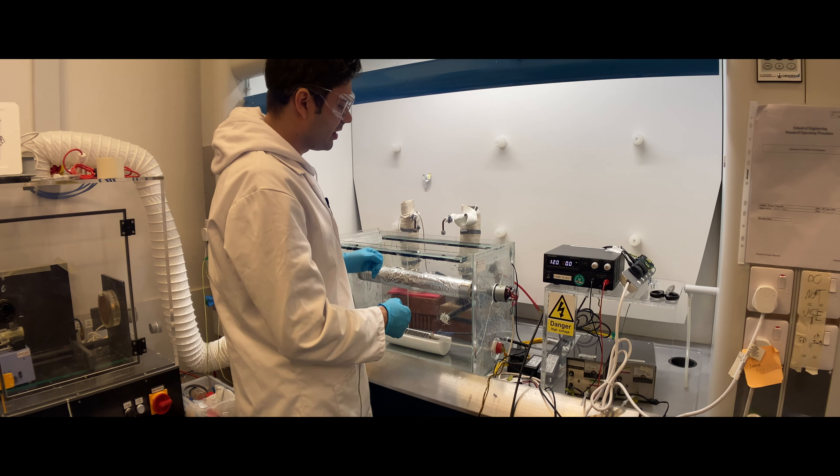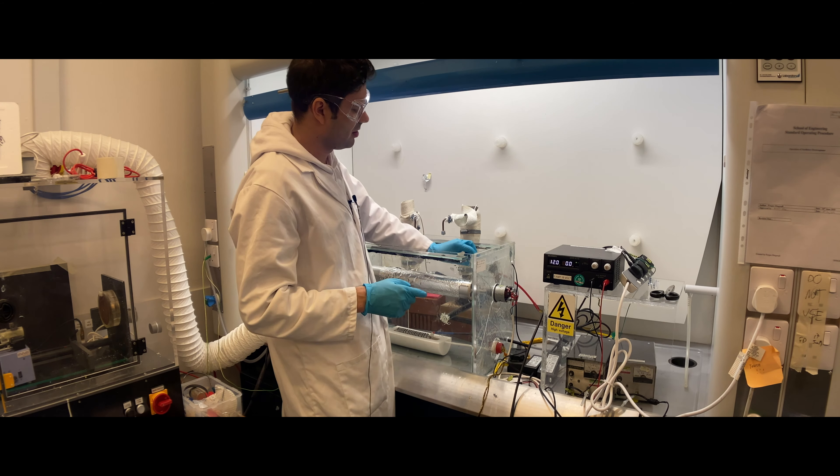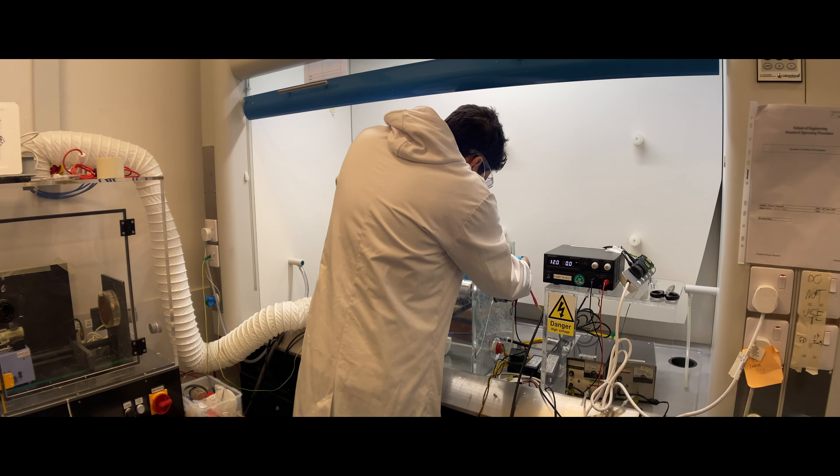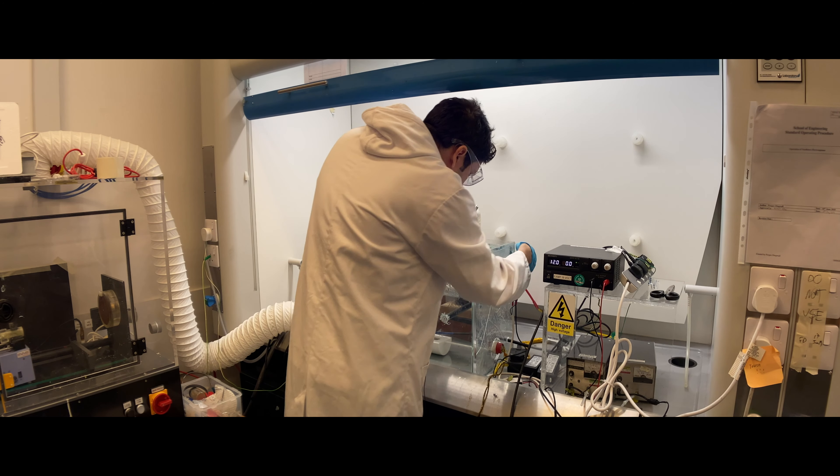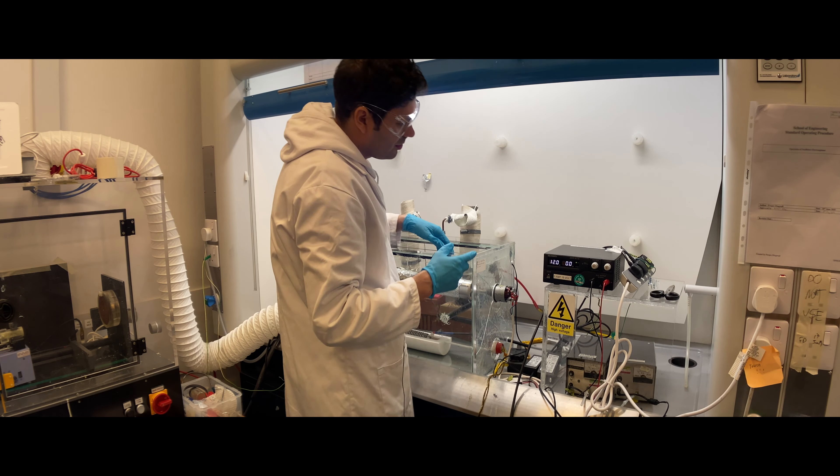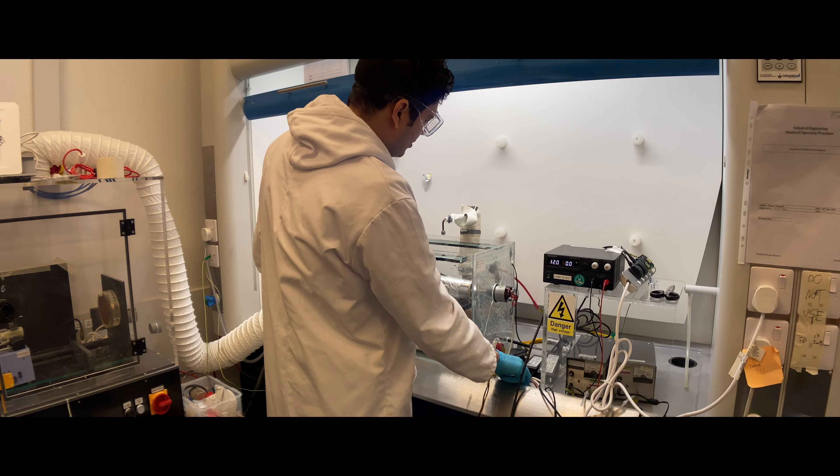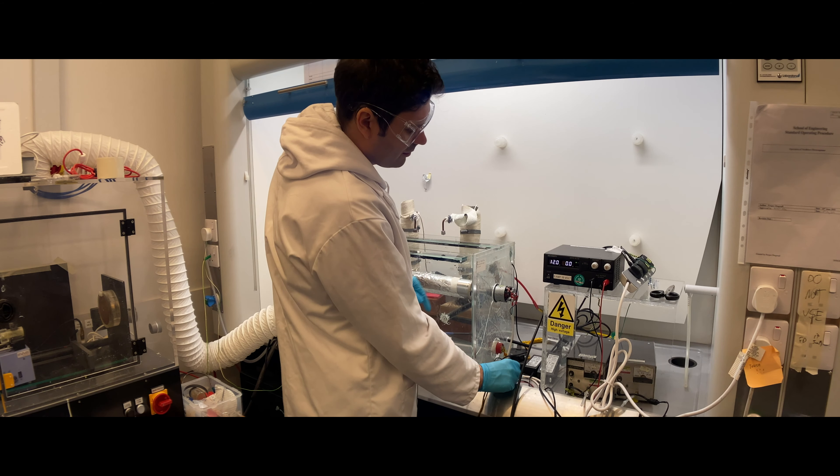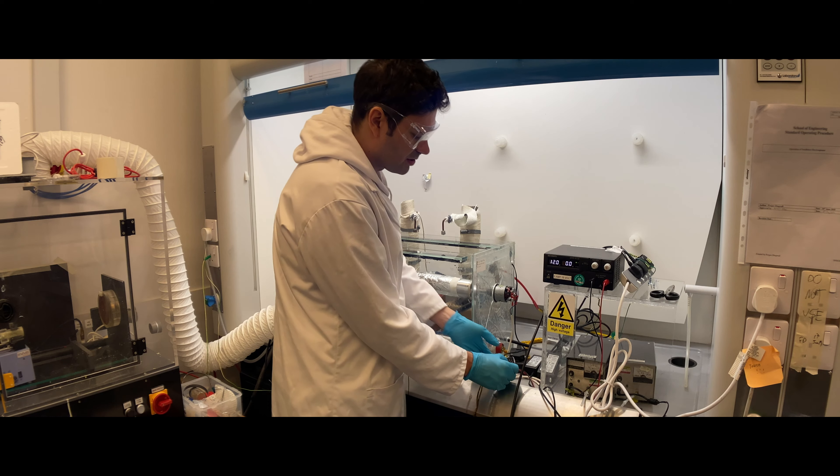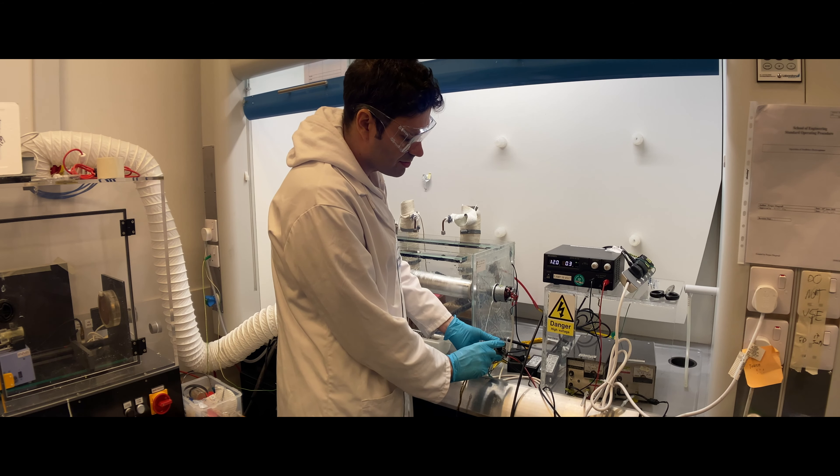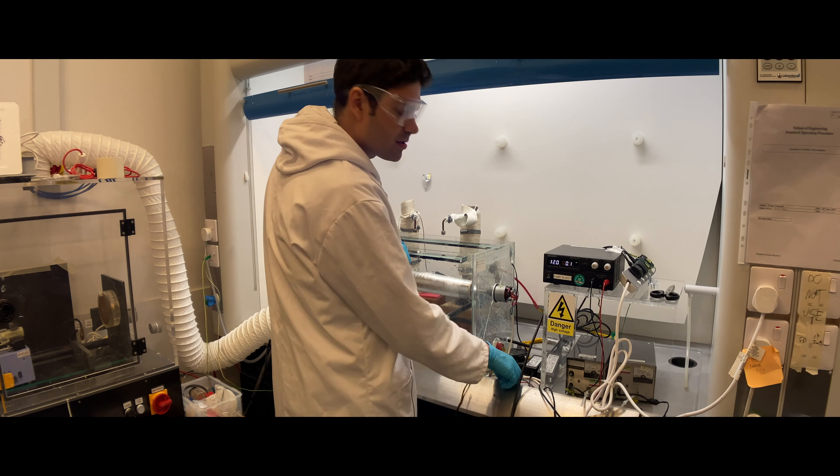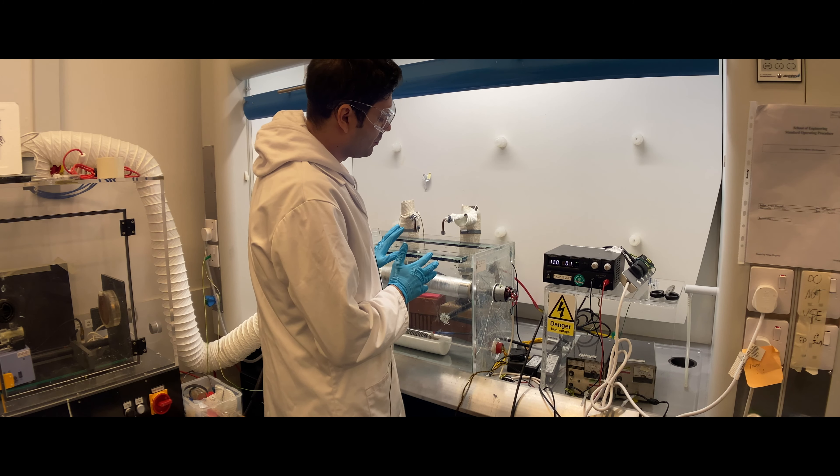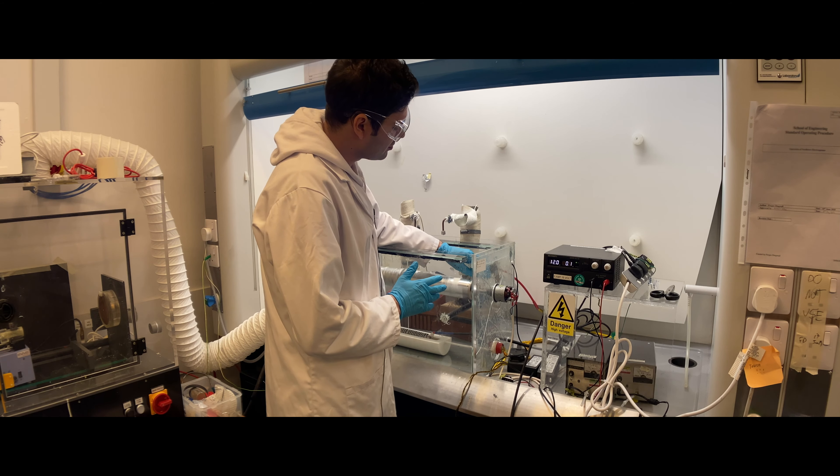Now let's go to the collector part where we have the negative DC voltage coming. This cable here is the negative DC voltage, and this needs to touch the collector all the time. You can turn on the collector simply once you have voltage here—now it's 12 volts—by turning on this pot meter, and you can adjust the speed by this lever. If you don't need aligned fibers, I would suggest you use it in a lower RPM setting.